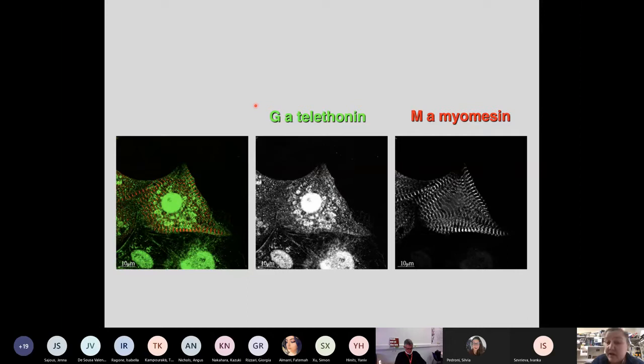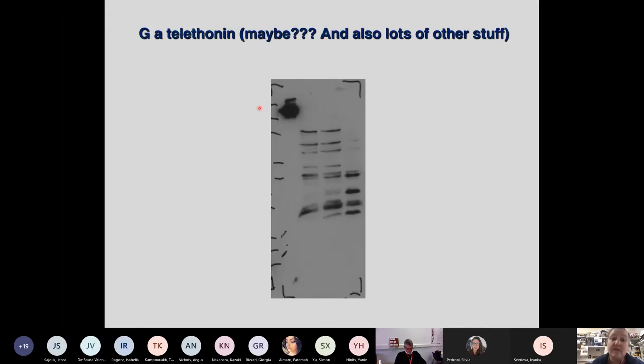So this is a commercial antibody. So if you were naive, you might think, well, it must work. But then what I always recommend you to do is a Western blot, because you may find out things that you were not expecting about your immunofluorescence reagents. And in your immunofluorescence, you will only see where your fluorochromes land. So you have no other indication whether your tool actually recognizes what it's supposed to recognize. So when I was using this Holy Cross anti-telethonin antibody on the Western blot, it maybe sees real telethonin, but it also sees a whole lot of other stuff. So this is obviously not a good tool.